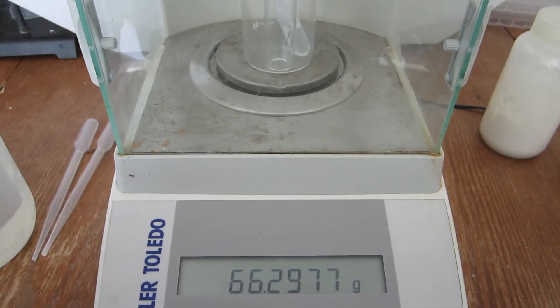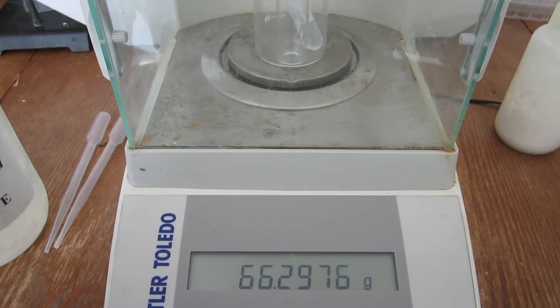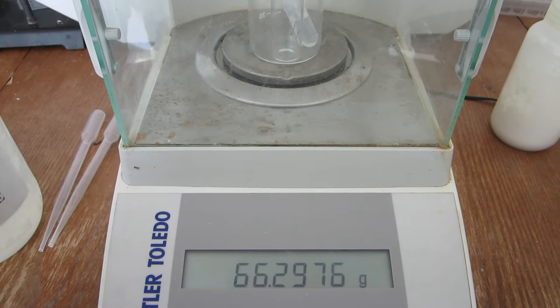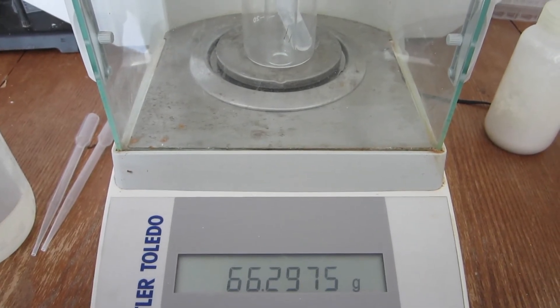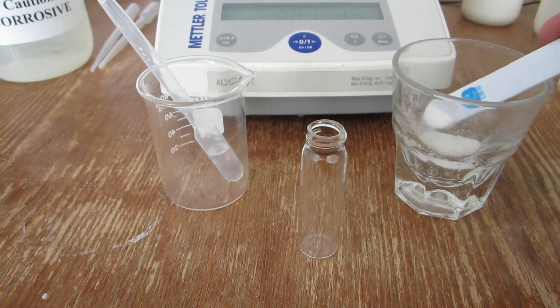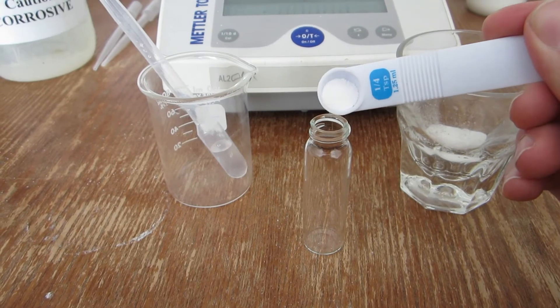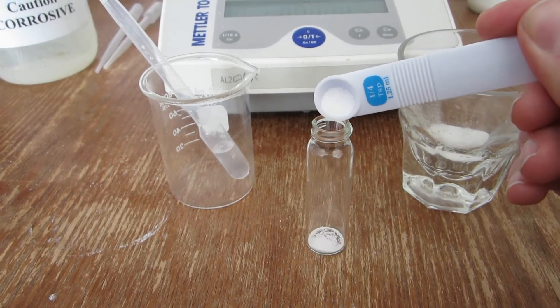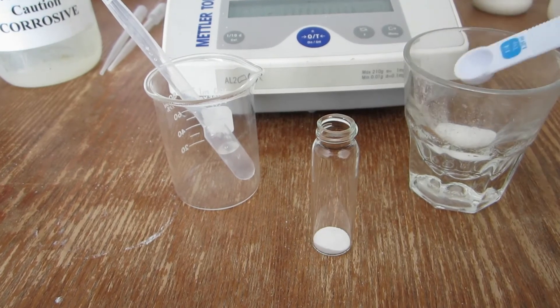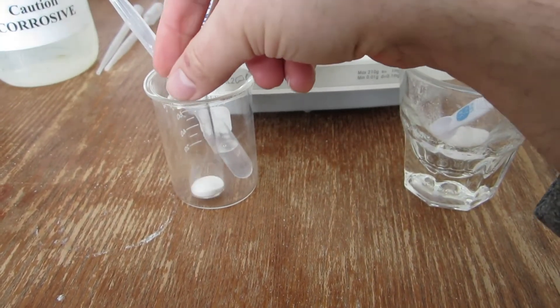In the first trial of the unknown carbonate sample, the mass of the empty vial, beaker, and acid is displayed. As with the baking soda sample, a small amount of the unknown carbonate sample is added to the vial, the combined mass of which is then weighed.